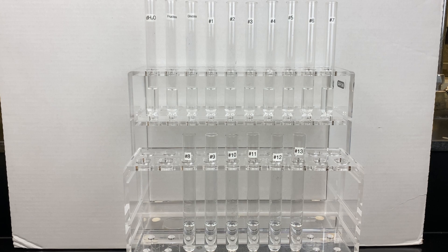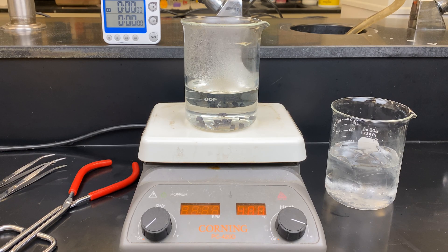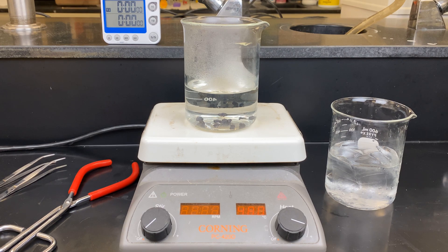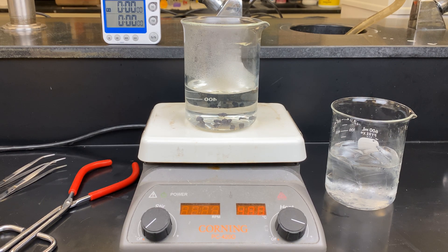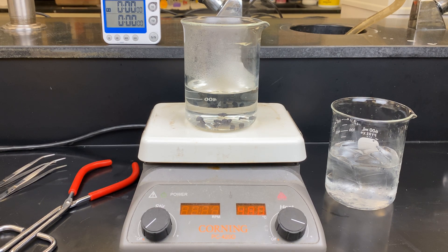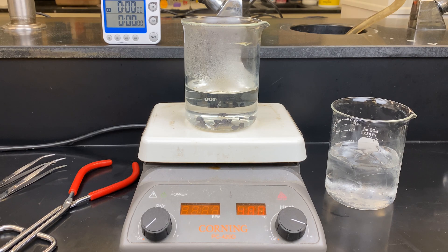Water will be our negative control. Fructose and glucose will be our positive controls — fructose for a ketose and glucose for an aldose.